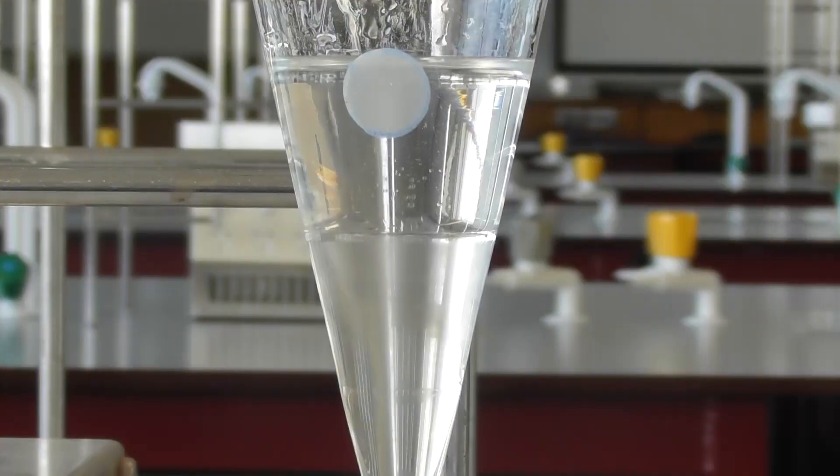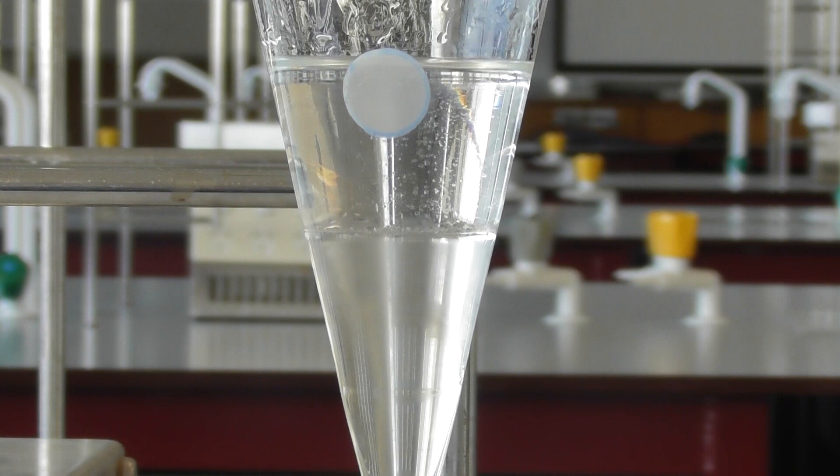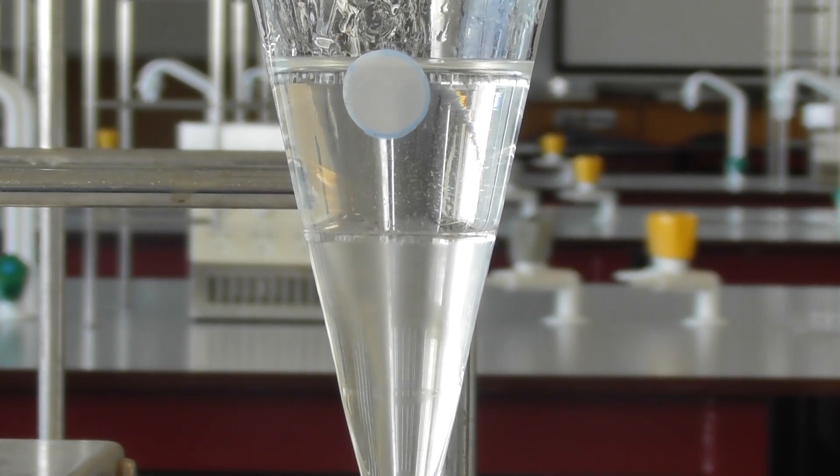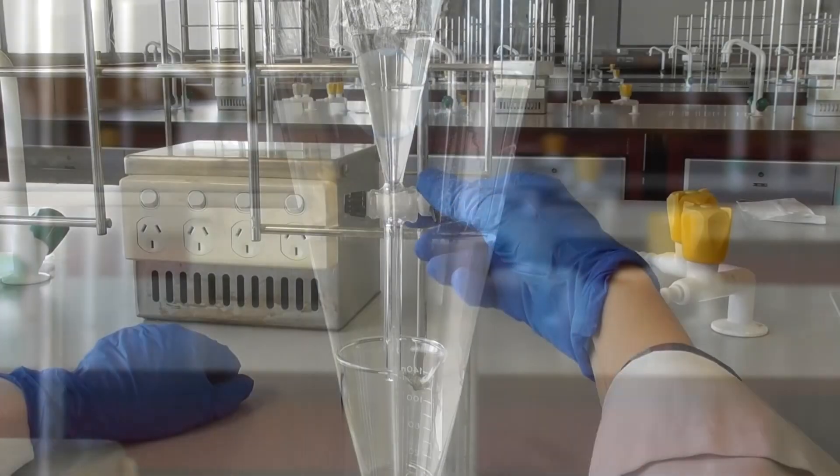If you can't see the boundary between the layers or are unsure which is the aqueous layer, just add a few drops of distilled water.